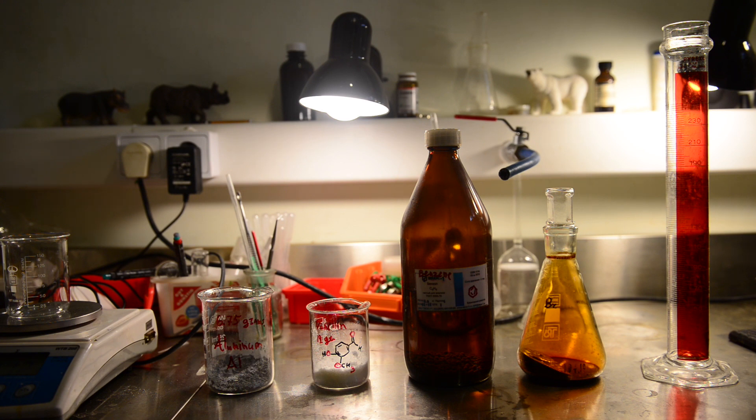I have learned on the science madness forum from cyclonite that US patent 2975214 is worth trying. The reason why I like this method so much is that it doesn't require us to obtain anhydrous aluminum bromide, aluminum chloride or pyridine. In this preparation I actually need aluminum bromide but in this case it is prepared in situ which means in the reaction mixture.